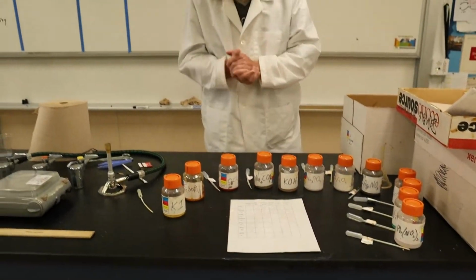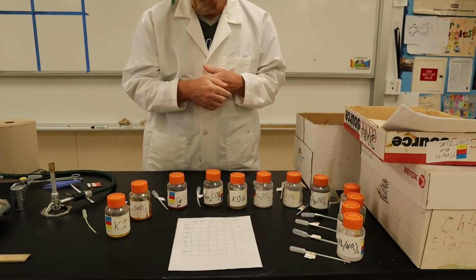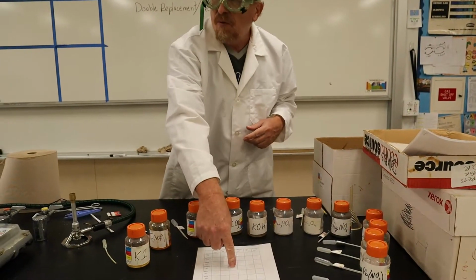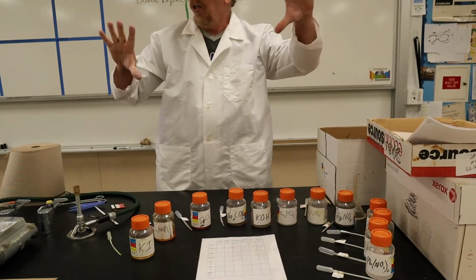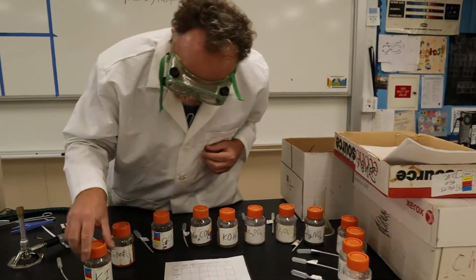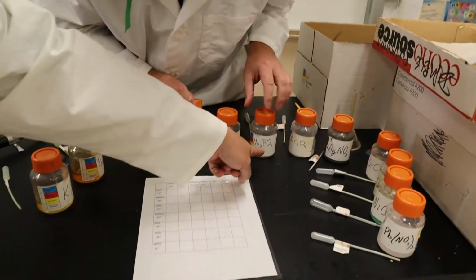All right, so here we go. I guess I'm just going to go left to right then. Sure, you can go. The cool thing is you can go in any order you want. I'm going to do the middle one first. Okay, so sodium phosphate. Question is, where is sodium phosphate?